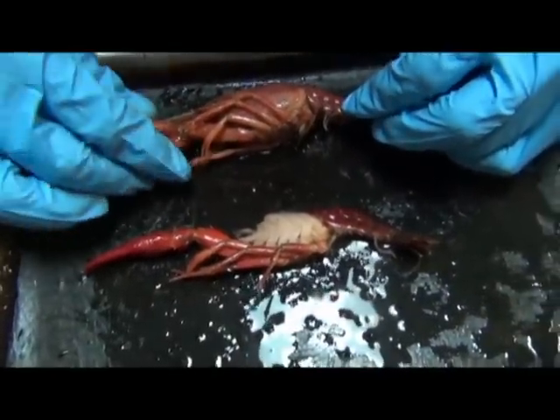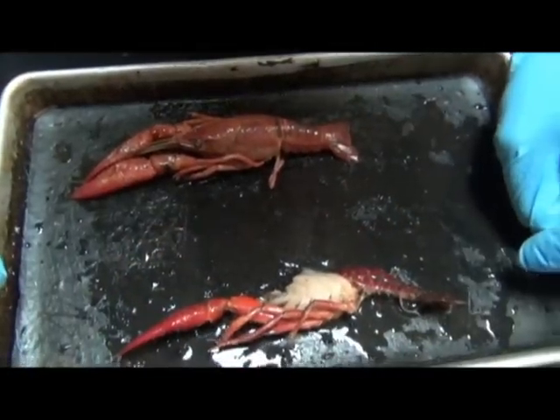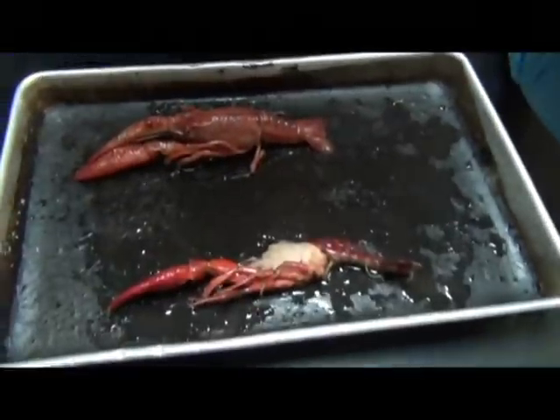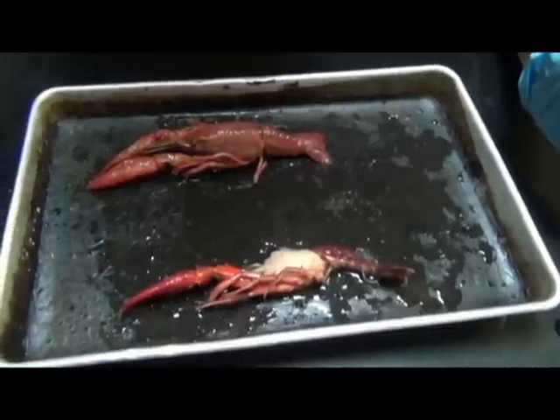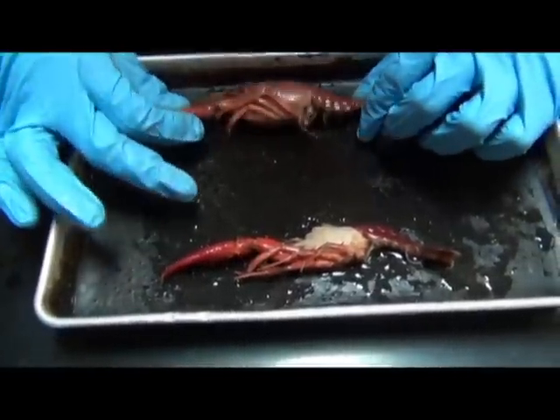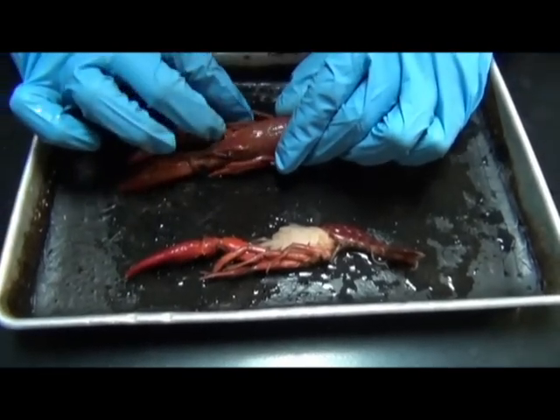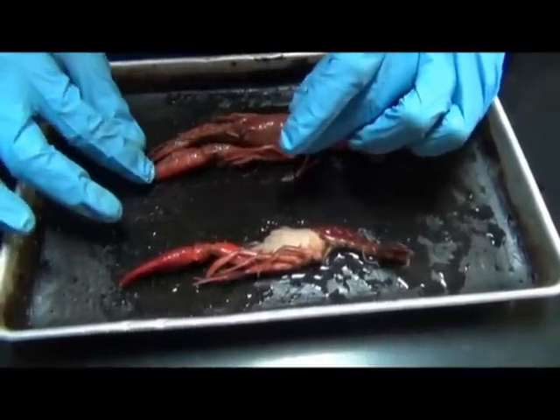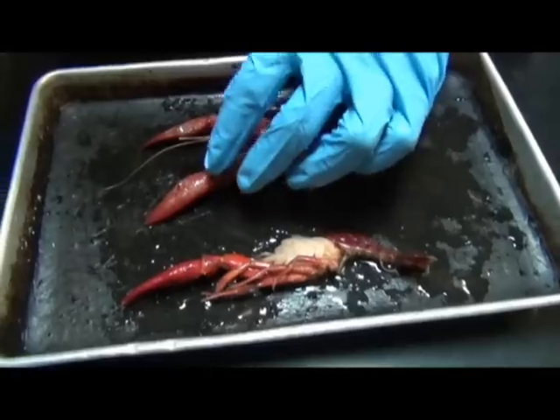Okay, so that really pretty much summarizes what I'd like for you to know about this animal, that they're crustaceans. Crustaceans are characterized by having biramous appendages. Their stomach is in a weird place. Their major nerve cord is in a weird place. Their gills are in a weird place. Overall, though, it's an animal that you've probably been familiar with for a long time, but if you hadn't known those other things about their anatomy, then hopefully you have a little bit of a greater appreciation for them.